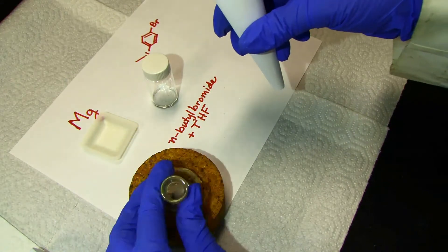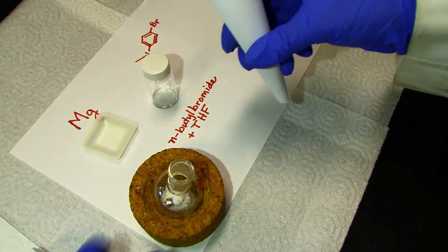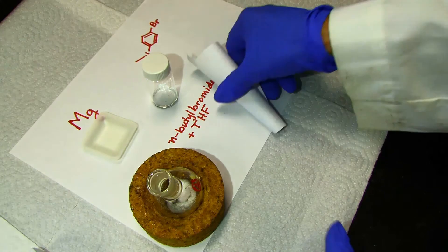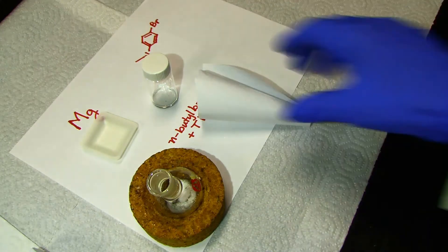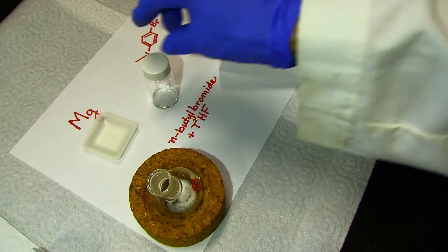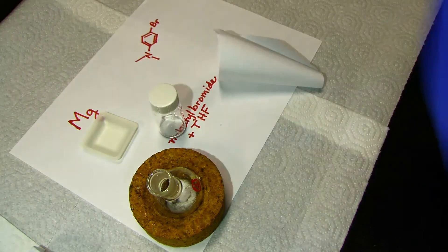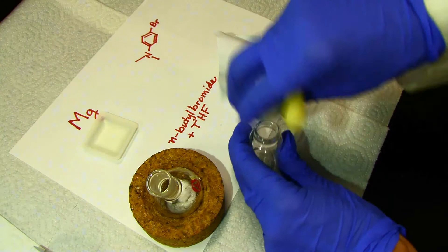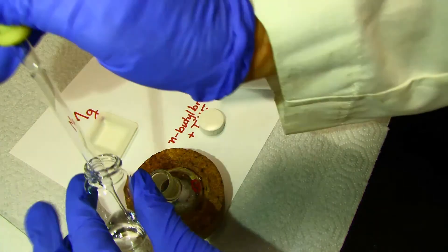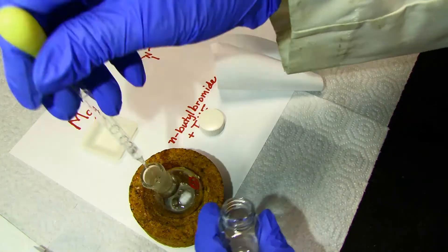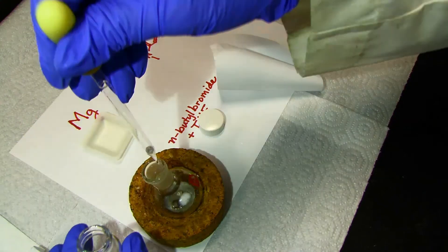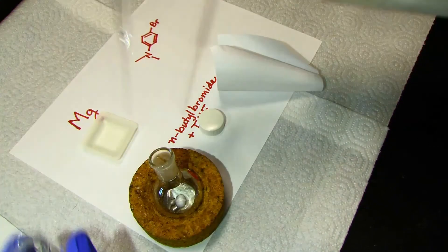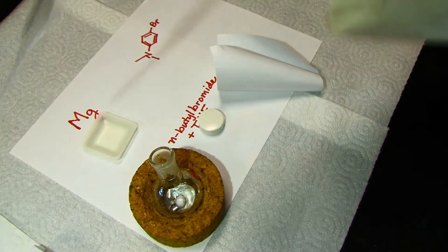Get a tiny bit outside the flask. So my weight is a tiny bit off, but at this point we really have an excess. So even if you spill a little bit, you're all right. Okay, now the liquid.